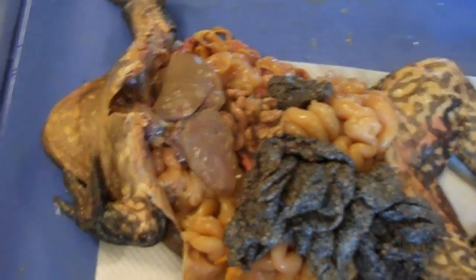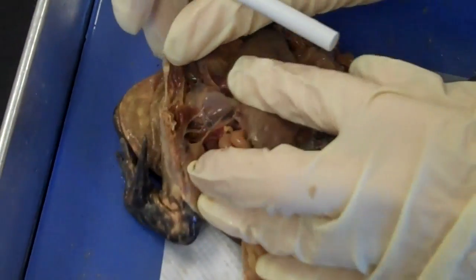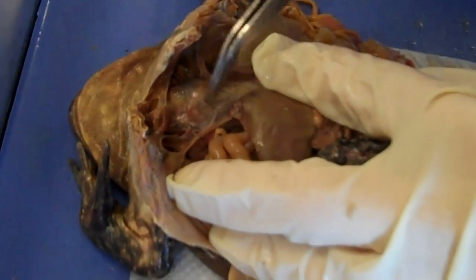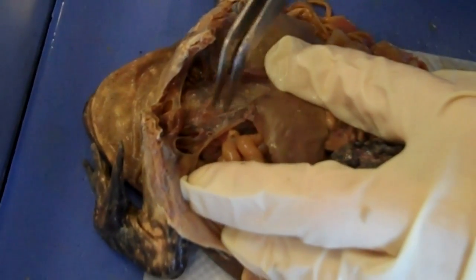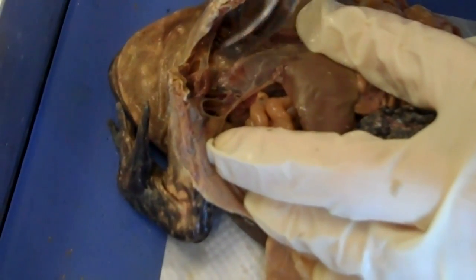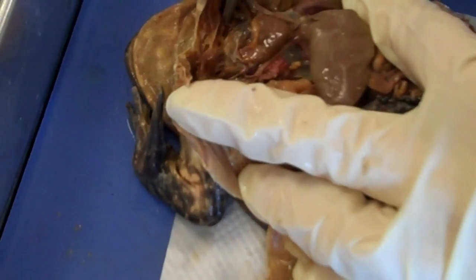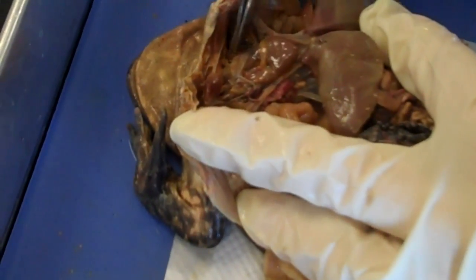So this is the female. You have your three-chambered heart — two atria and one ventricle. This is in the pericardial sac; it hasn't been opened up yet. You should know that there's two atria and one ventricle.